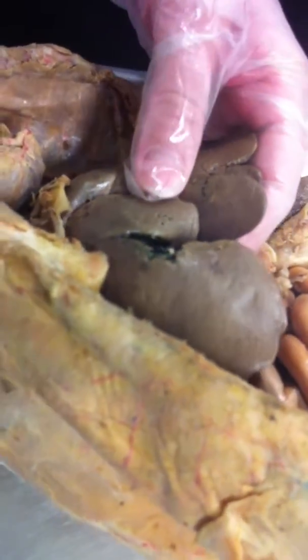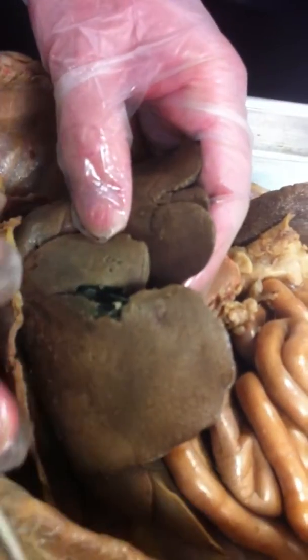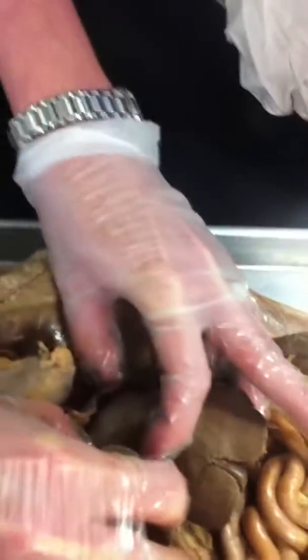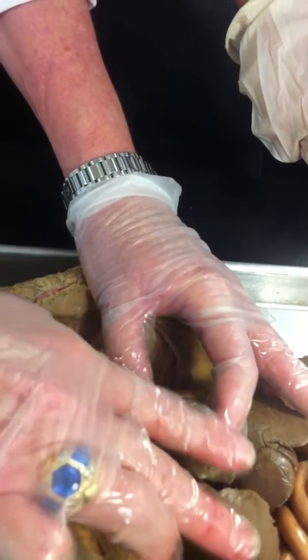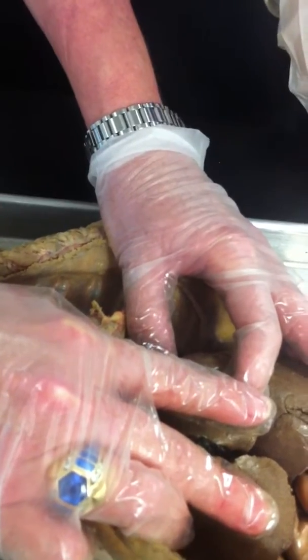The liver is this great big thing right here. And the rugae are the stuff that allows the stomach to stretch, like those punch balloons that you can blow up. So with the liver, you have two medial lobes, two lateral lobes, and a little tail-like lobe at the back. This one that contains the gallbladder is called the right medial lobe.